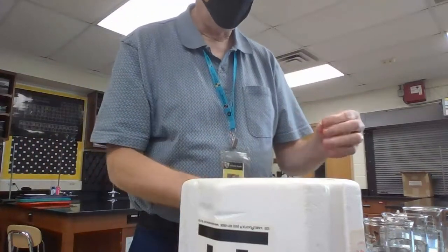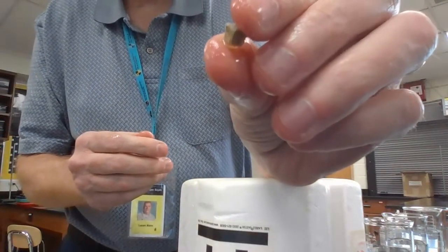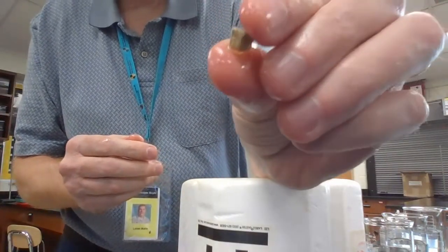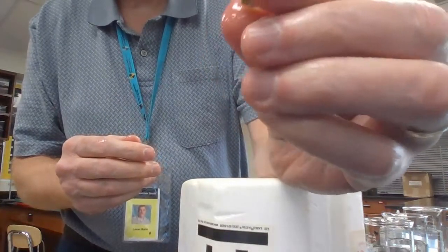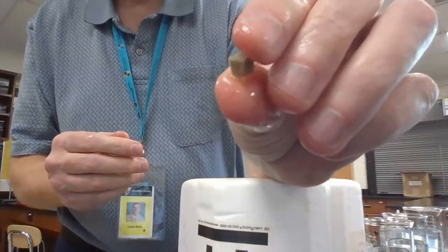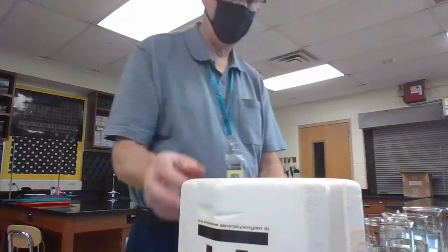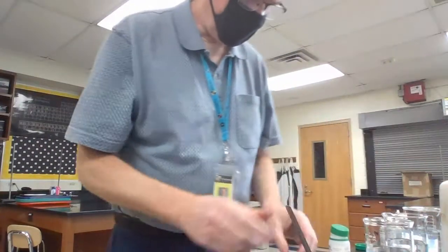This one's a weird looking metal though. So if you take a look at that one, it doesn't look shiny at all, and it almost looks like, I don't know, a yellow light gray rock. Looks like rust, like it rusted. Yeah, oxidized. So what I'm going to do is try to cut this like I did with the other one.